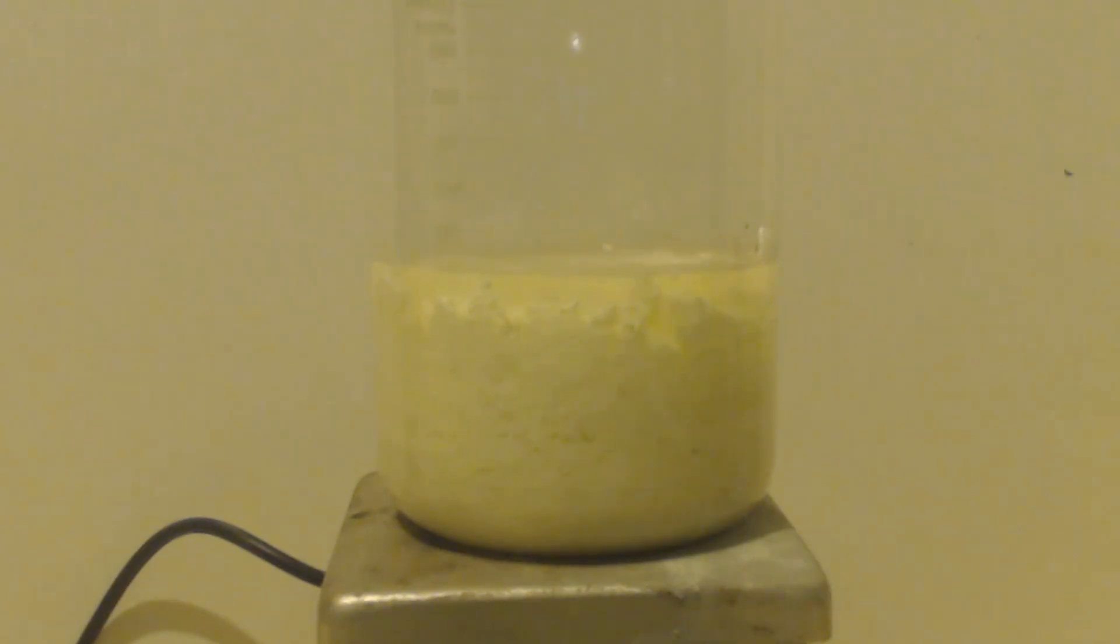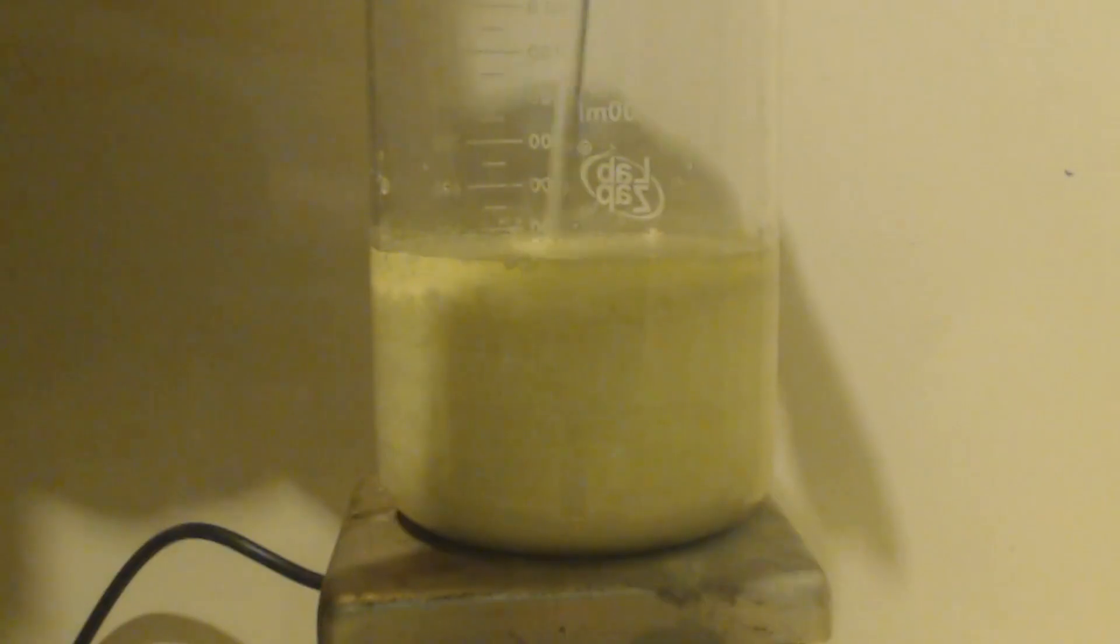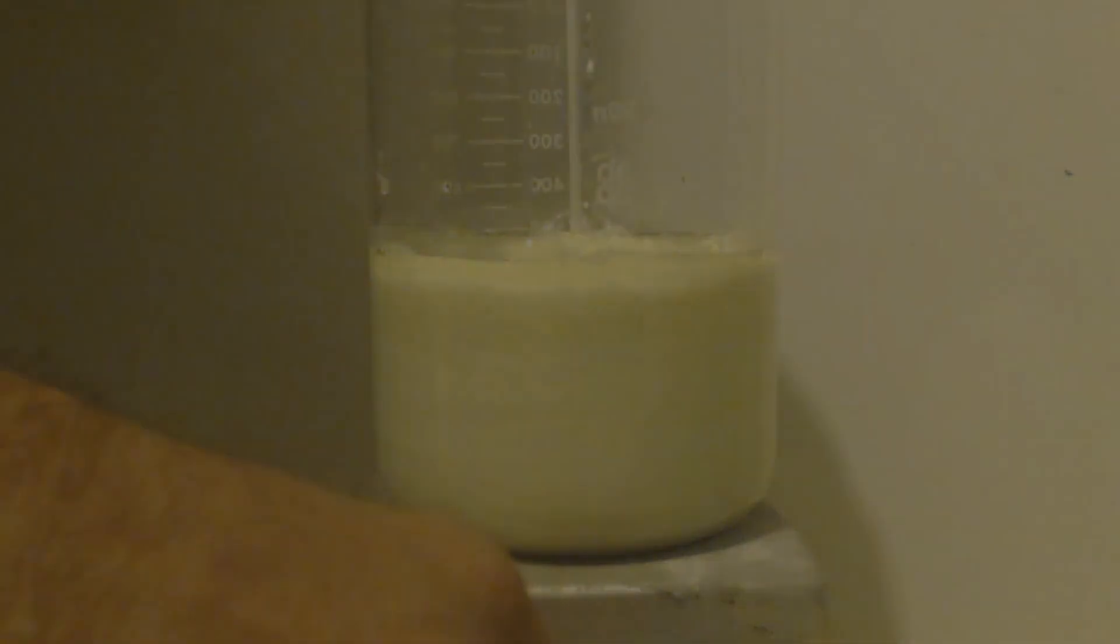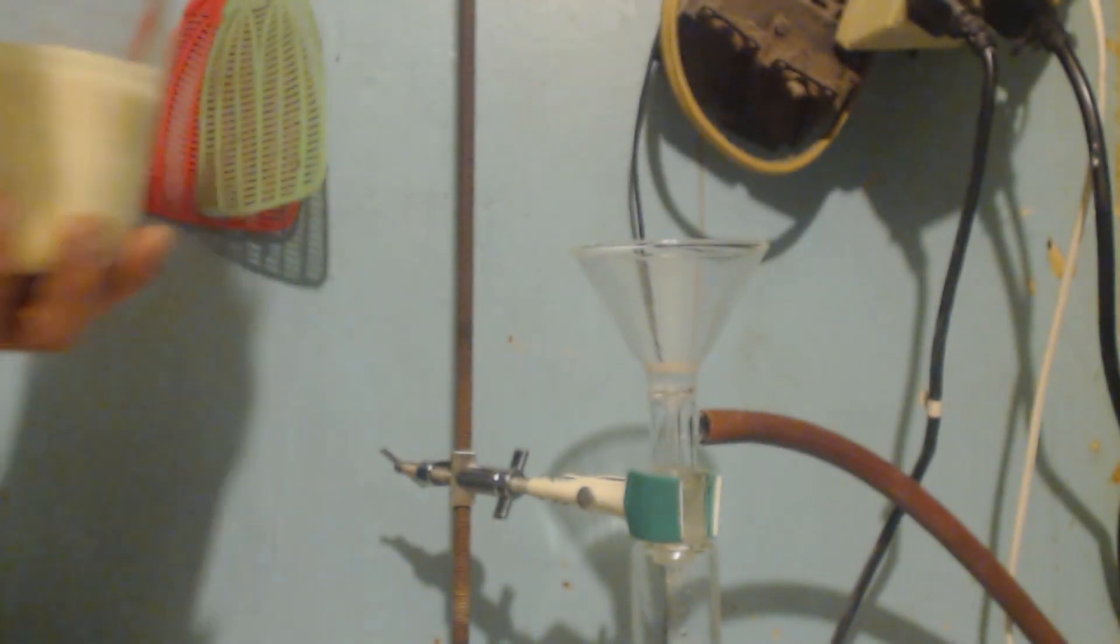I'm going to clean out my cup a little bit there with some water. And I'm going to turn that stirrer on. All right, so it's too thick to use my stir bar. I'm going to have to stir it by hand for maybe 20 minutes or something like that. All right, so let's stir it about 15 minutes.